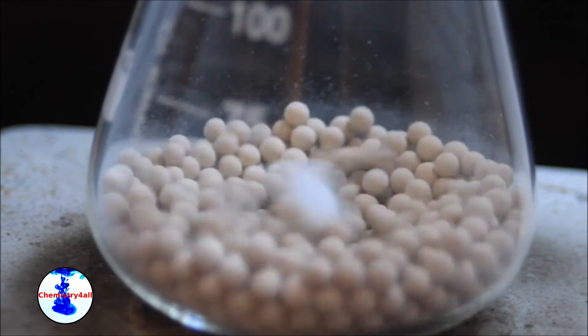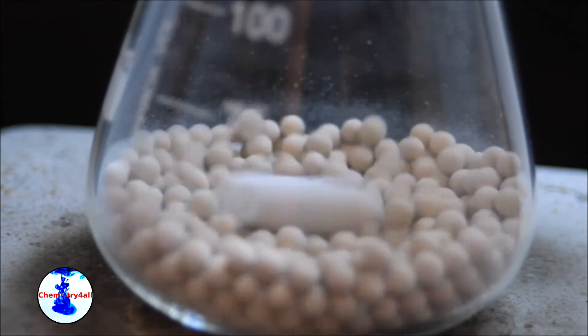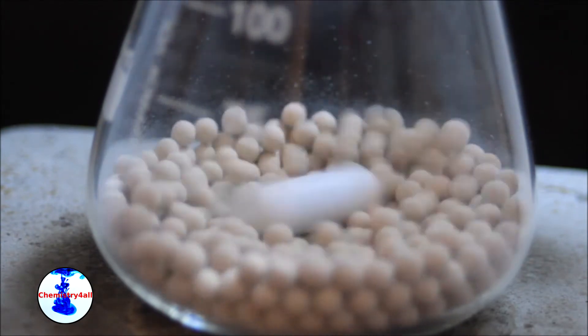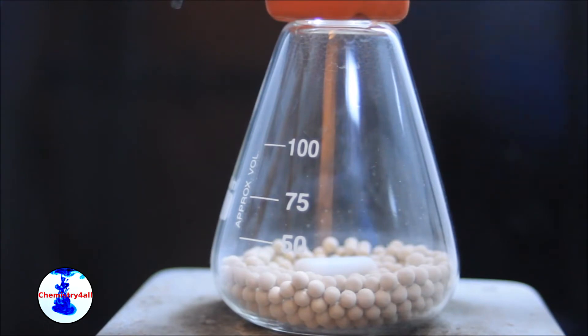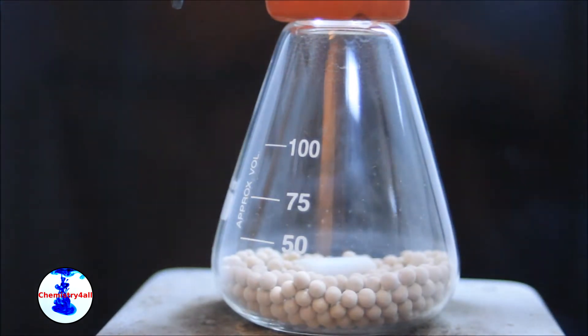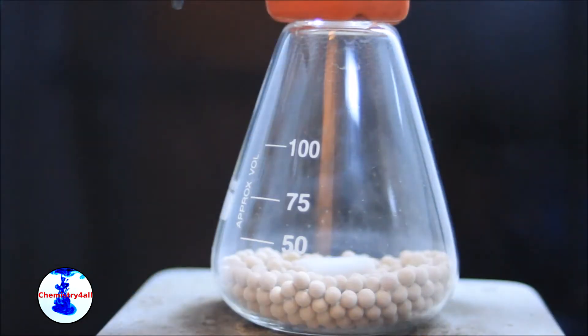So we have to do as many heat and vacuum cycles as required until no more water is released by the molecular sieves. When no more water vapor is released, we have successfully regenerated our sieves.